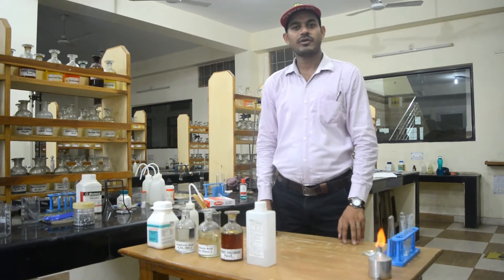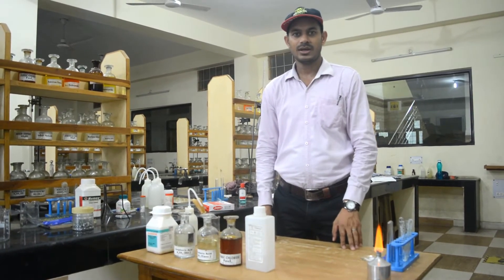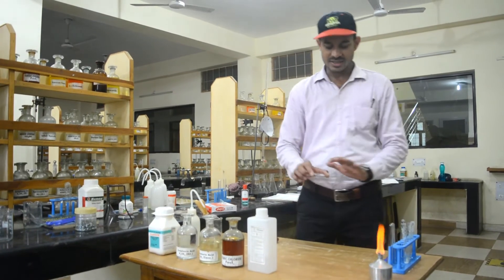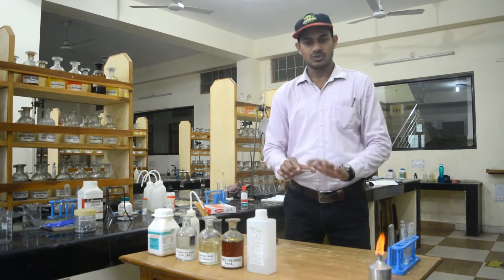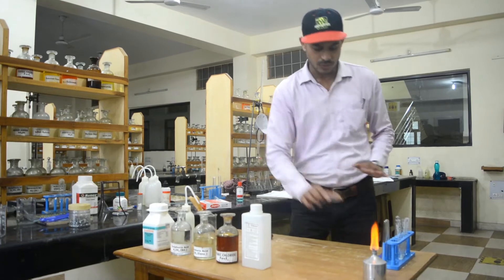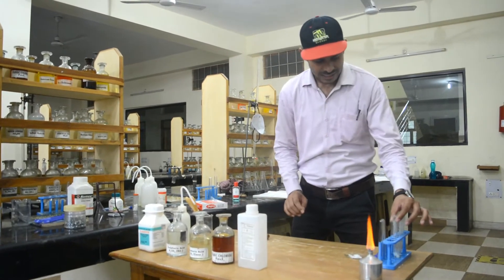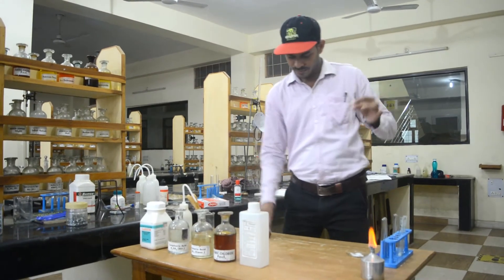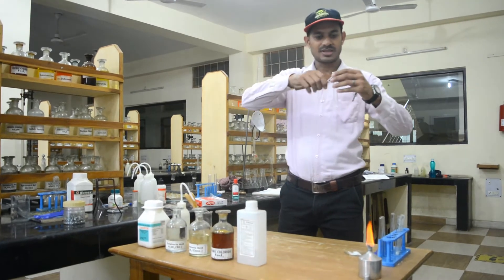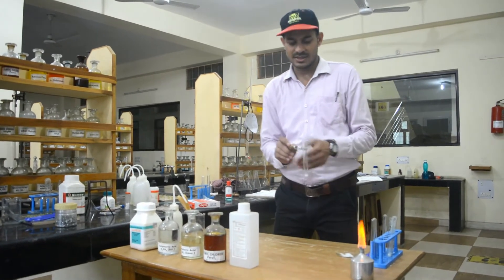Students, we will perform the test of acetate ion. I have already taken the lead acetate salt, and from this salt I will test the acetate ion. The salt has already been taken in the test tube. In the first test, I will add dilute sulfuric acid to this.